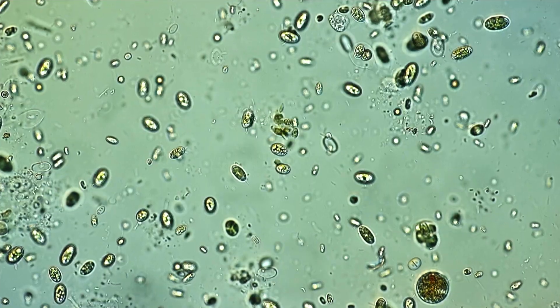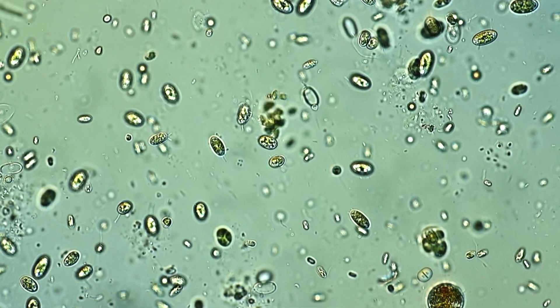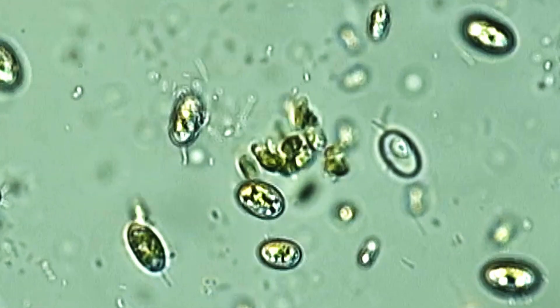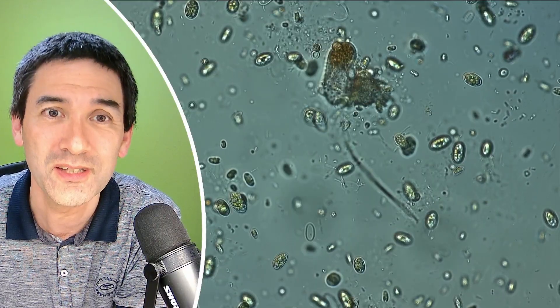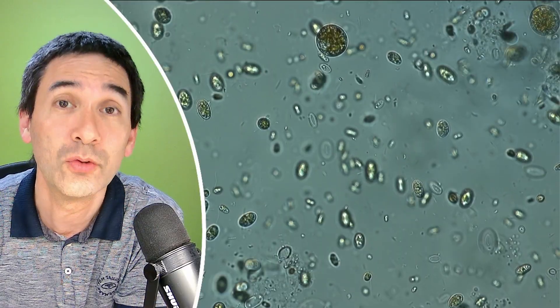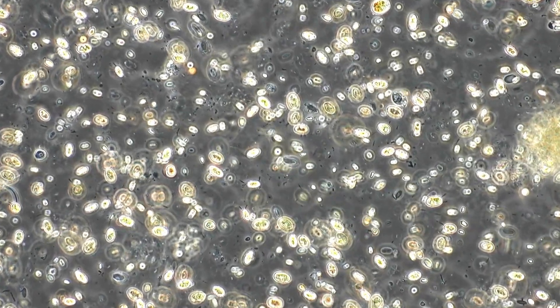It's not a very fast centrifuge — it's around 4,500 rotations per minute. So the G-forces exerted on those cells were not that high, and therefore many of them survived this process. I think a centrifuge like this is actually a pretty good investment, and it's also then not necessary to filter the water to concentrate the cells yet further.